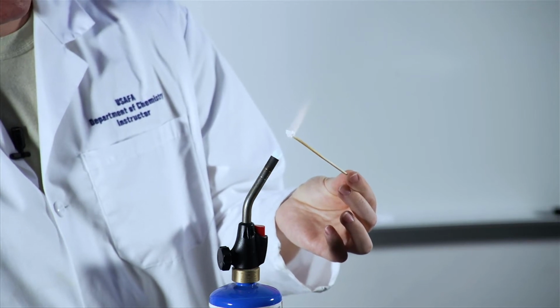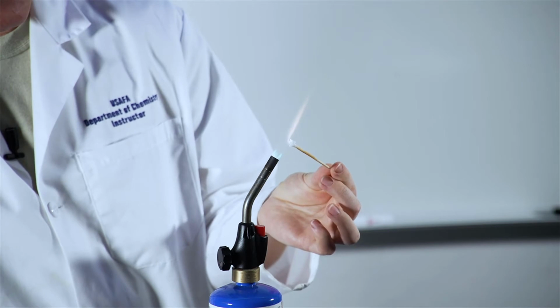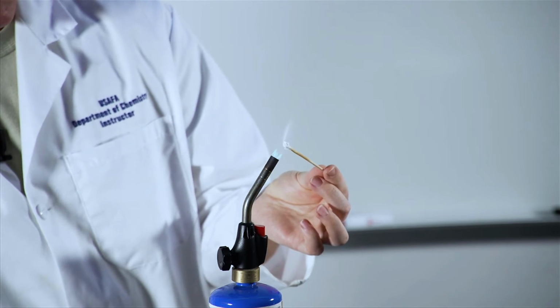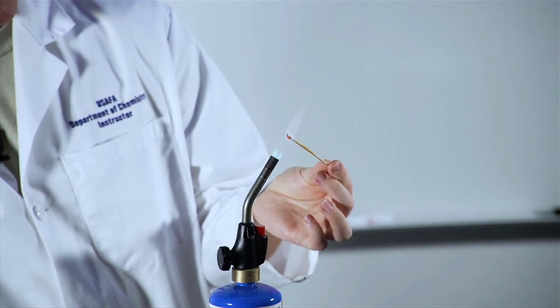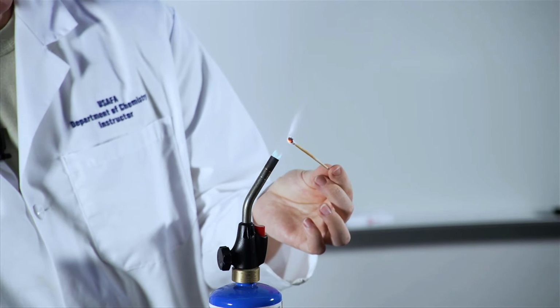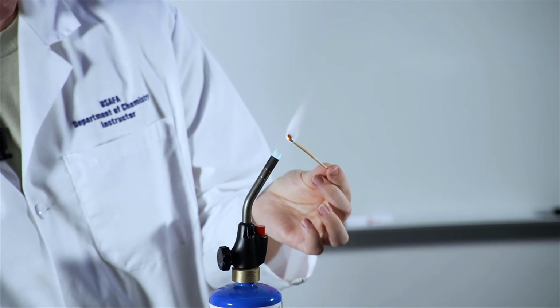And what that should indicate is that maybe there's a little bit more energy here. I don't know if you can see it that well, because it's kind of the same color as the blue that we get from the torch, but it is a violet purple color, a little bit more energy in that transition. And part of the reason for that is there are higher energy levels for this particular atom, or the electrons in this atom, to occupy.